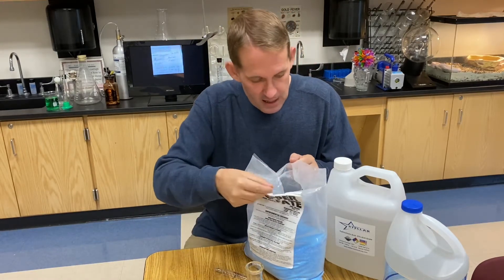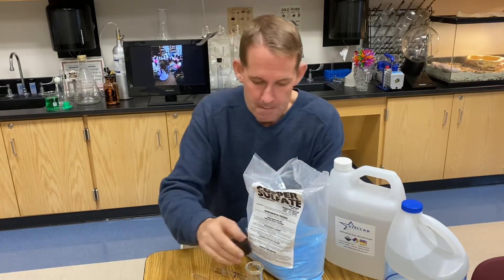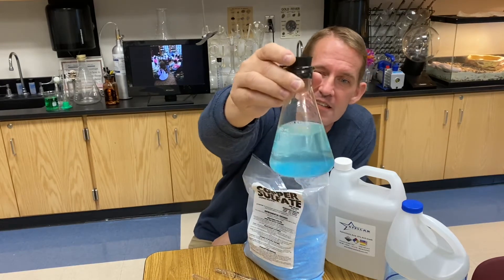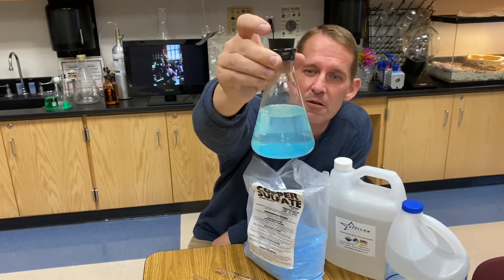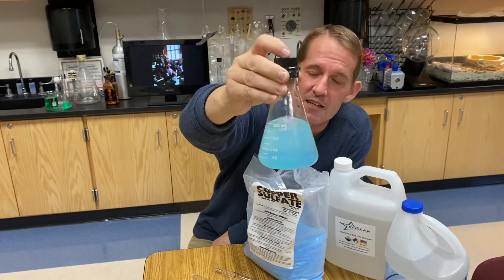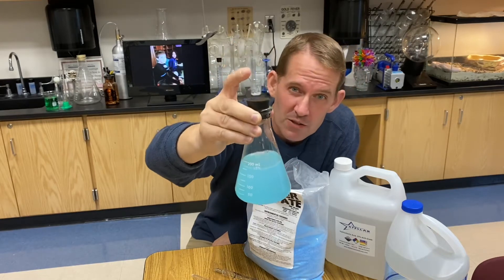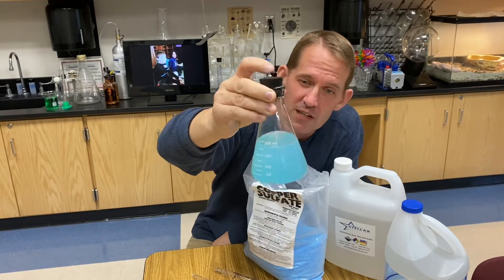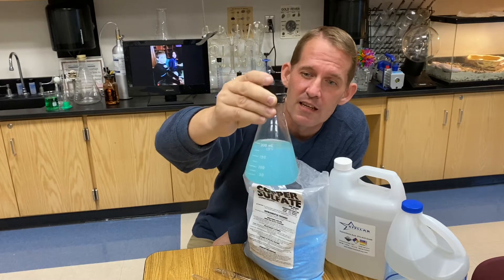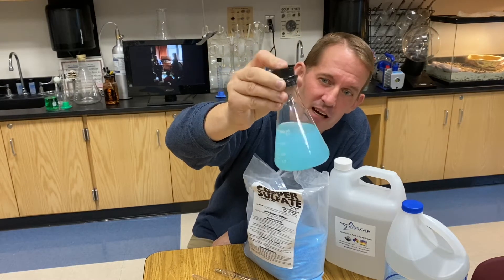I'm going to start out by putting a little bit of copper sulfate into a flask of water and shake it up. You see this nice pale blue solution. This copper sulfate has been hydrated, and the water molecules are now creating a complex ion, where the water molecules act as the ligand — they donate electrons to hold on to that metal ion in the middle.